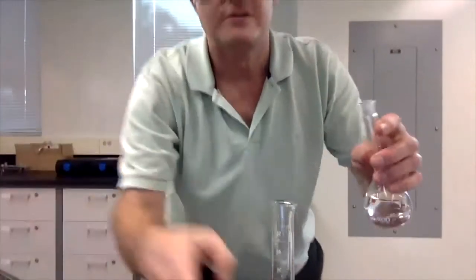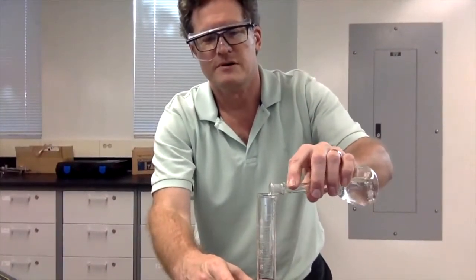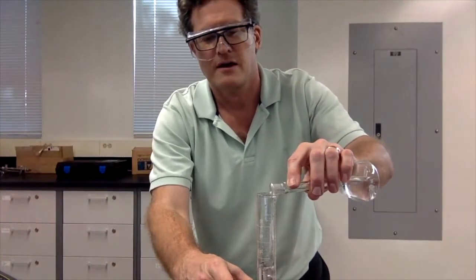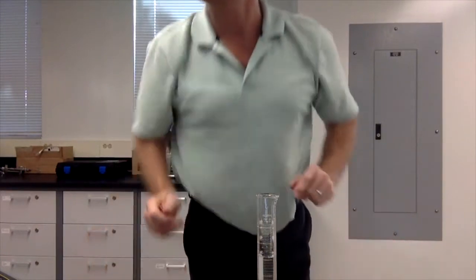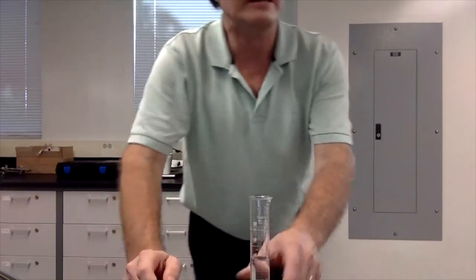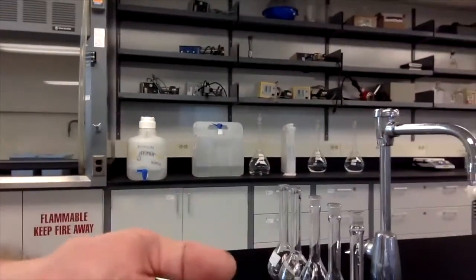Instead, we need about 30 mLs. So let's fill this up with about 30 mLs worth. There we go. Good, right? Okay, and then, right, because we need 30 mLs of solution, right, that we used deionized distilled water to get that background down low.